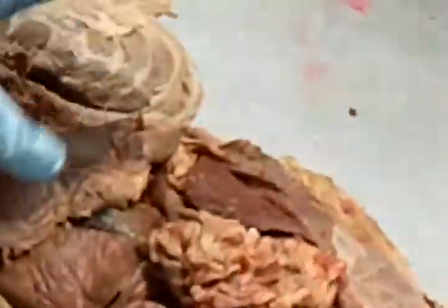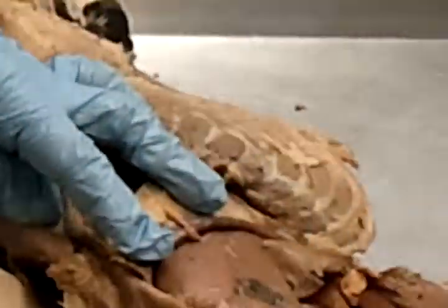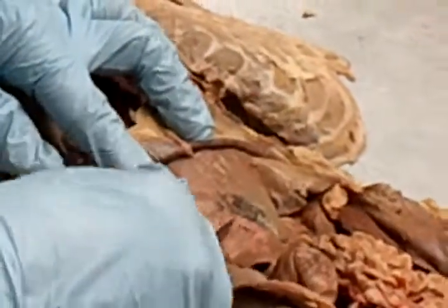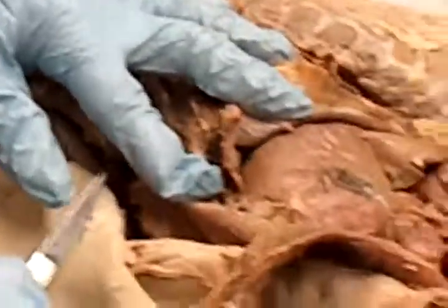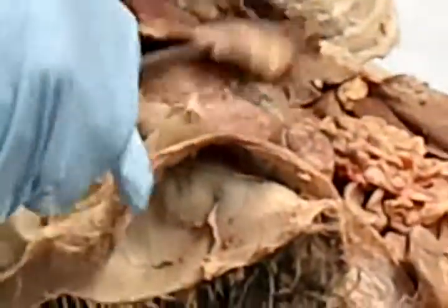And just to identify structures, under the diaphragm, which is intact here, is the liver. So all of this structure right in here, and there's just some little dried, clotted blood, so don't worry about those speckling. But all of this is the liver. That little bit of green staining is where the gallbladder is peeking through. Bile is greenish, so it leaves a little stain.